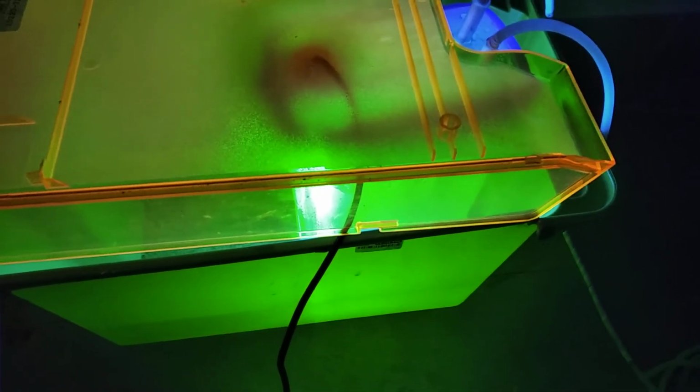And I've tested it. It really is amazing. These electrodes are dying, but the salt level is getting lower because more of it's turning into hydroxide. It's building up on the other side. Membrane is surviving because of the lower voltage.